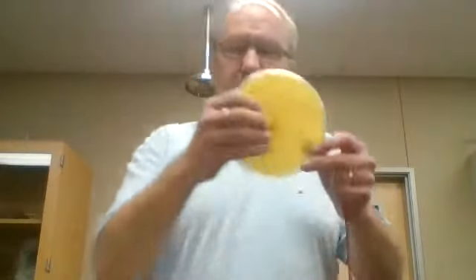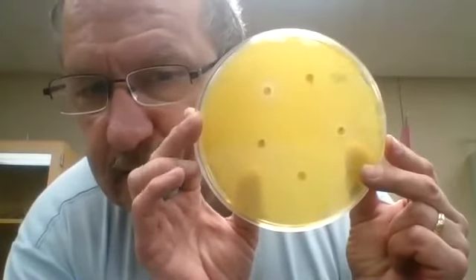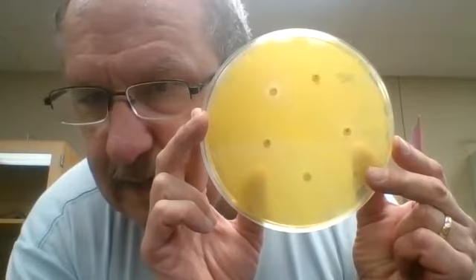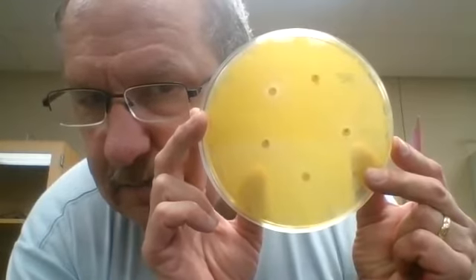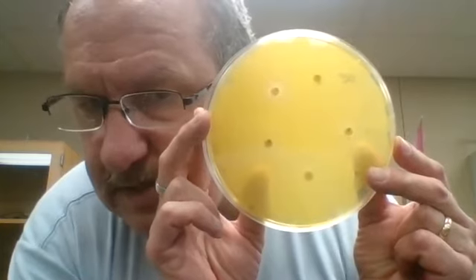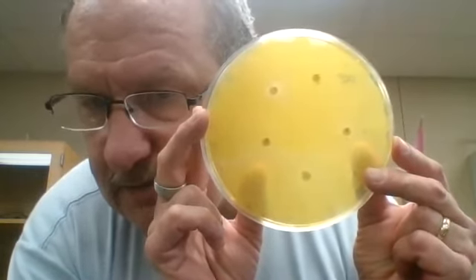And then finally, Pseudomonas aeruginosa. One of the things you'll see with Pseudomonas aeruginosa is the bacteria basically grew right up to the antibiotic disc, so there was little or no inhibition. In that particular case, when the bacteria grows up to the disc, then the zone of inhibition is merely just the diameter of the disc itself.